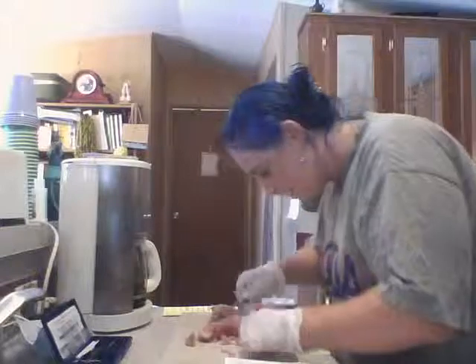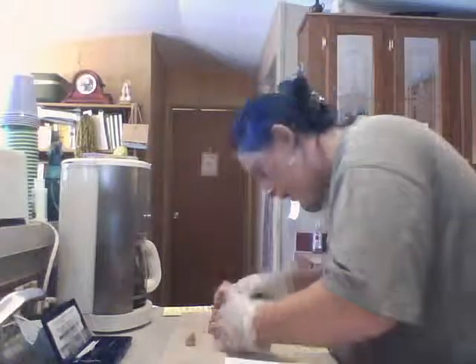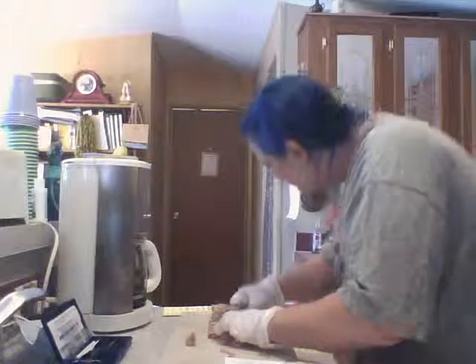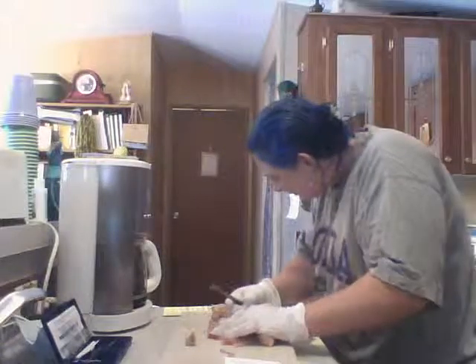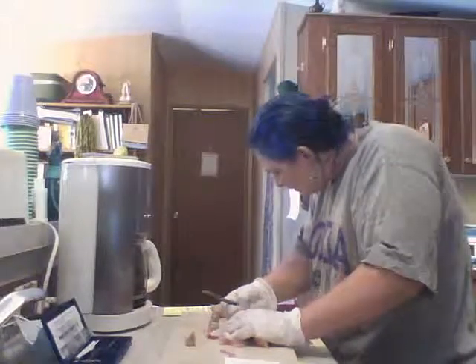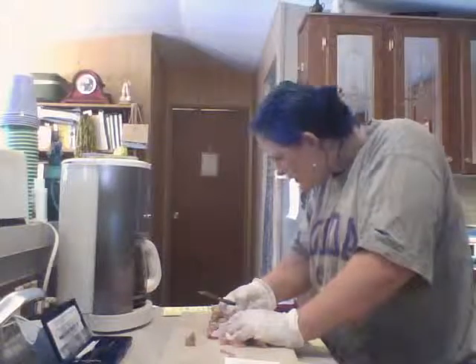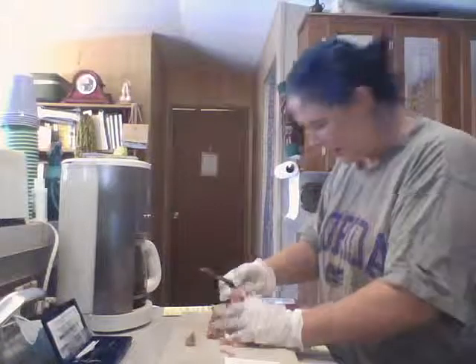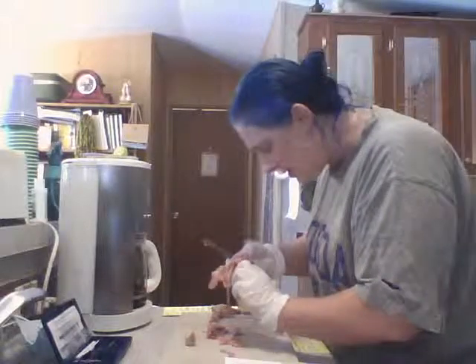Okay, it's covering here. In articular cartilage. Yeah.